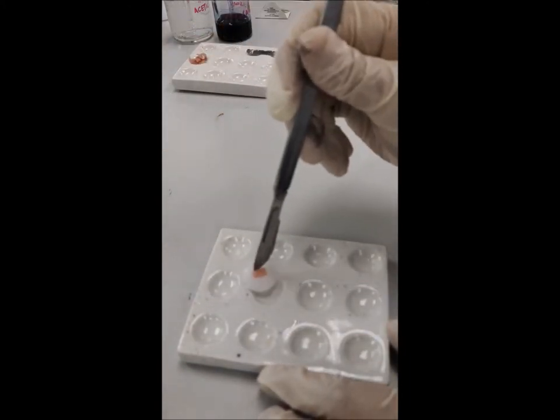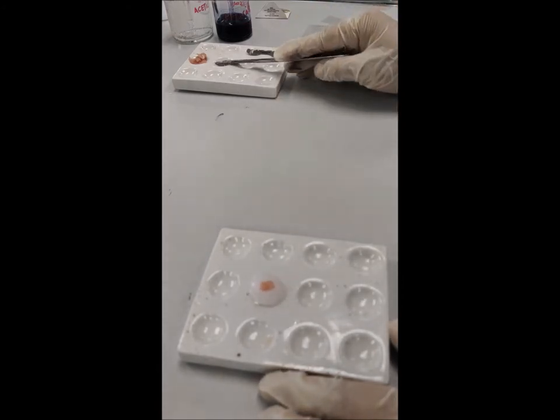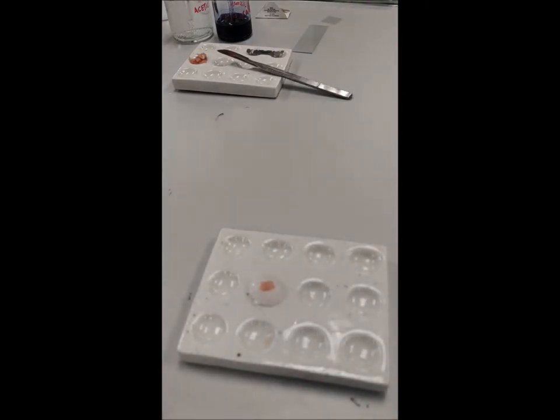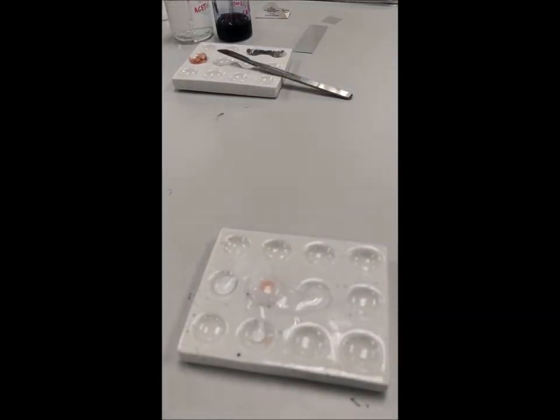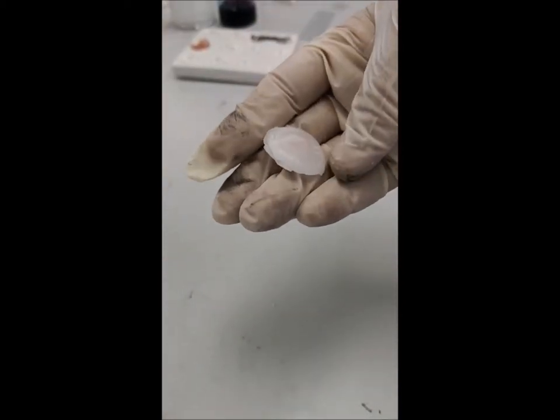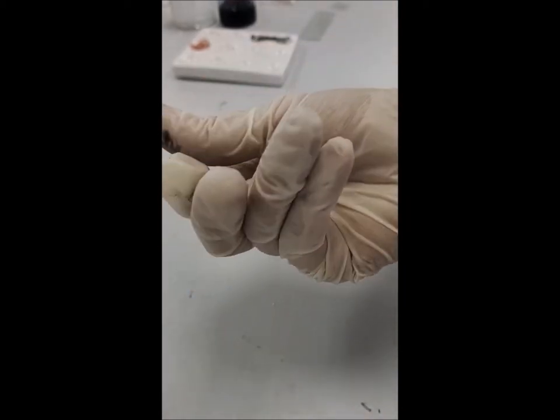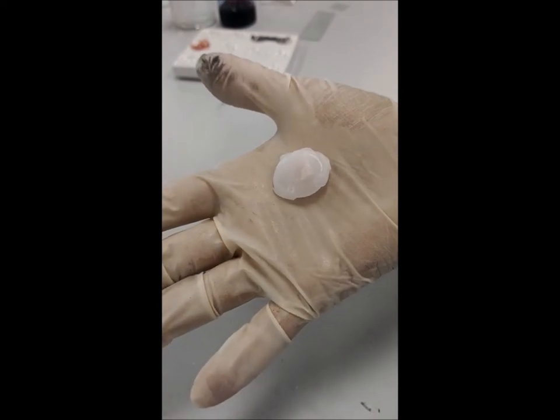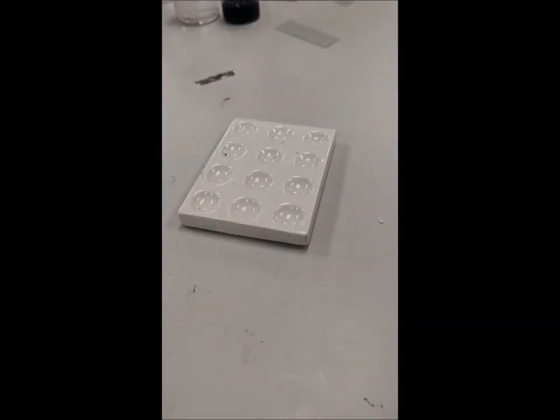Because I didn't have a proper plate, part of the sample is still outside the wax — I can put more wax on it. The sample needs to get dried well; it is still wet. I just leave it here to air-dry and get cold. While waiting for the sample to get dried, I will continue to prepare the other samples.